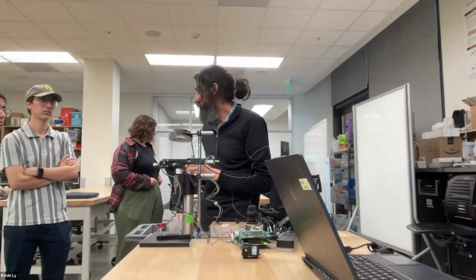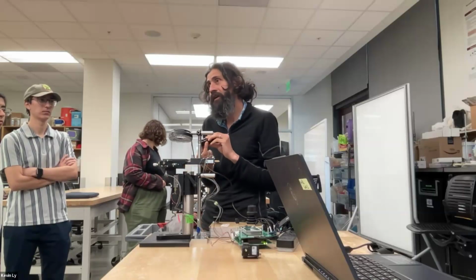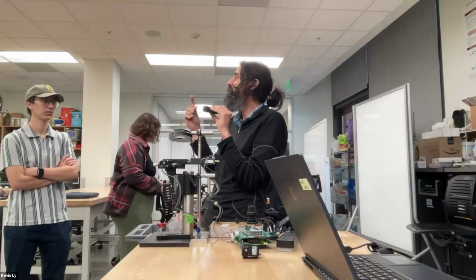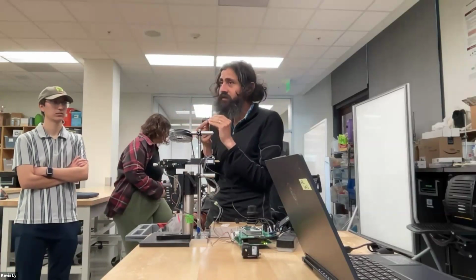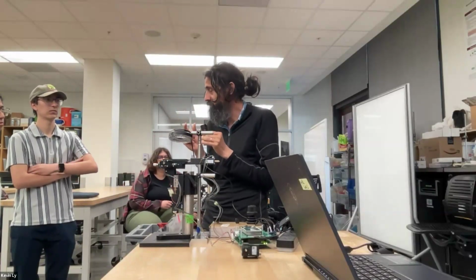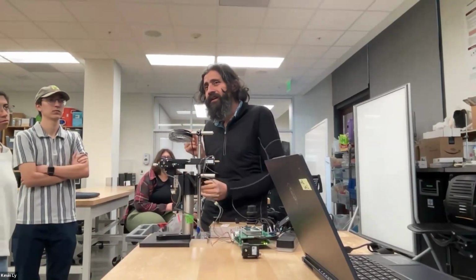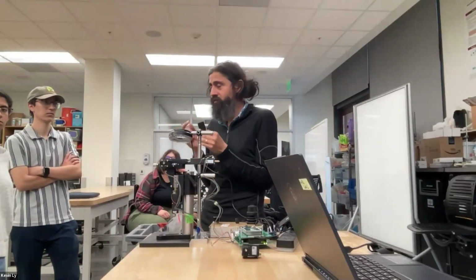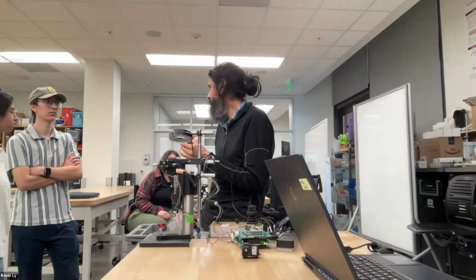We don't see it often, but you want to put the iris in a back focal plane, another point where there is convergence. Because one of the things you're trying to do is not cut off an image. With the iris, you're controlling intensities of light and how much light can enter your optic. So there are very strategic places you put irises.